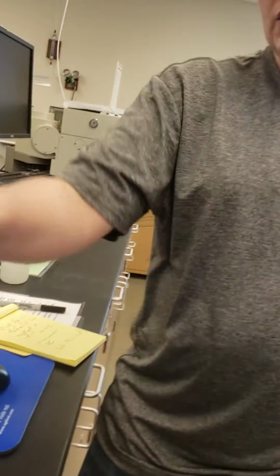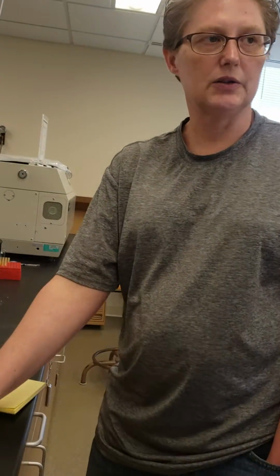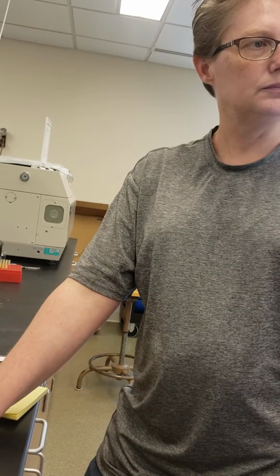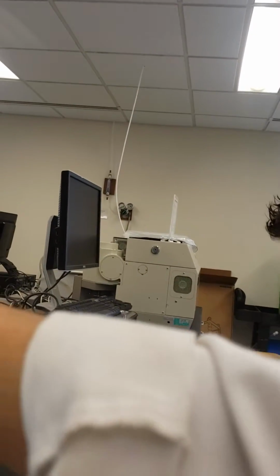We got a solid state drive. Oh, nice. And every year I will just move all the data over to the solid state drive. Yeah, because I have some files that I ran like a couple of years ago. I might need them, right. Yeah, so it'll stay here. We need to choose the previous years directory here.